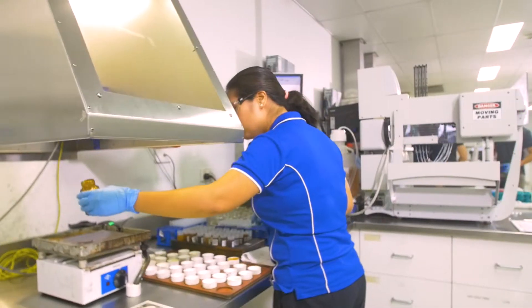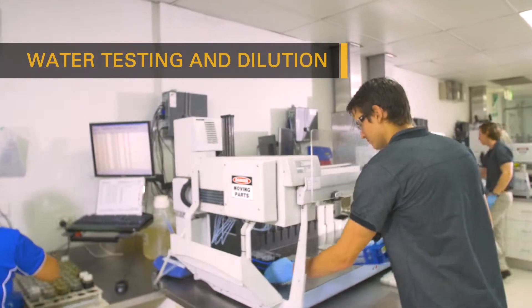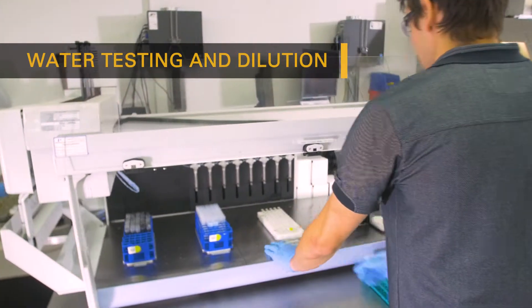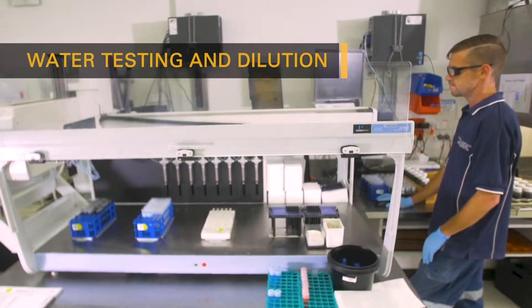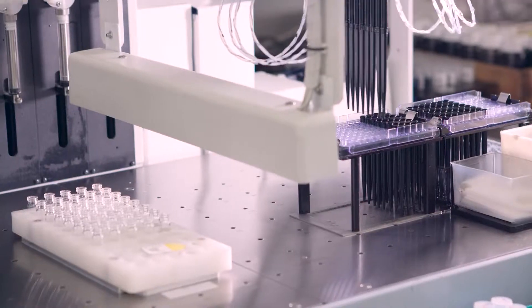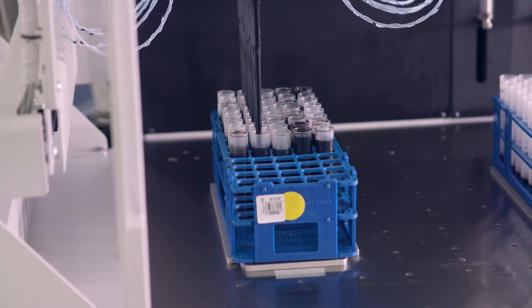We then move on to our water testing and the dilution of samples on the Janus autodiluters, which allows samples of fluids to run on the various pieces of instrumentation in the laboratory. The automated dilution of samples is being shown, and this process must be completed before analysis can start.